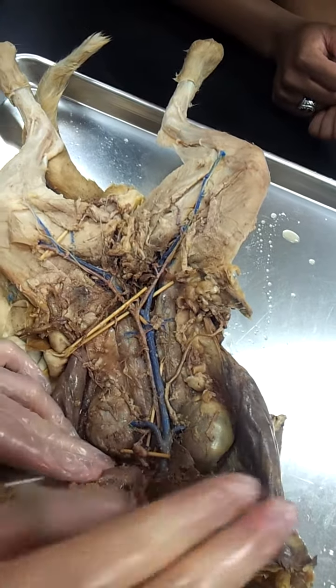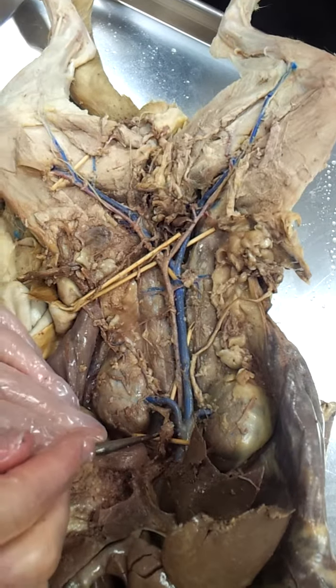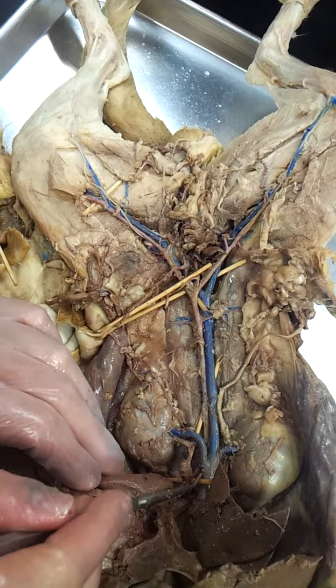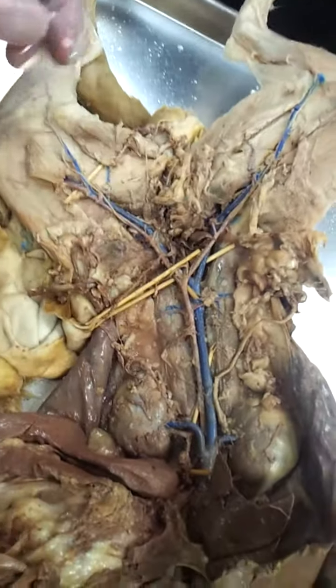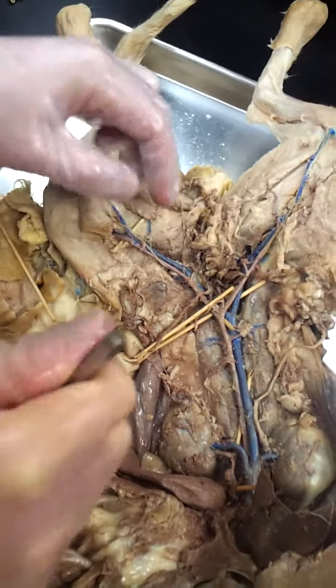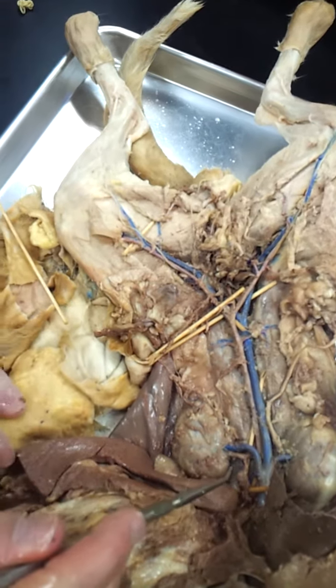Adrenal gland. On the human, it's going to be sitting right on top of the kidney, whereas here, if we use this cat, you'll have a nice view like that. If we don't, usually it's where the renal vein meets that IVC. You don't have the adrenal gland on there, right? We just saw it right there. Suprarenal. Well, the suprarenal gland is the same thing as the adrenal gland.